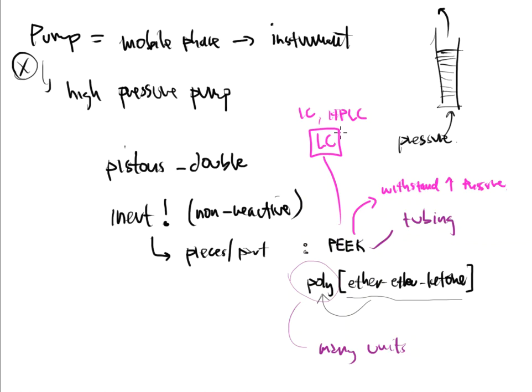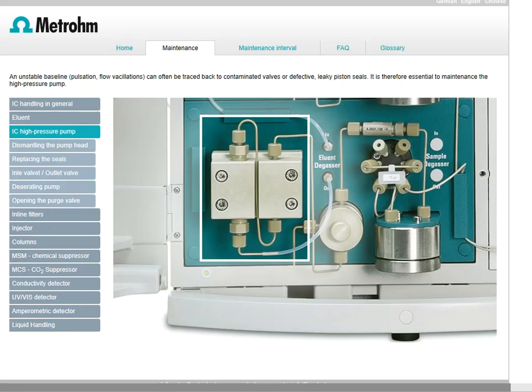All right. So let's take a look at this pump that we are talking about. What does this high-pressure pump look like? Well, hold on. Let me show you a picture. So here's an image of the internal of the IC instrument that you're going to see in our laboratory. So this is really for the Metrohm ion chromatography system. However, most of the ion chromatography systems look very similar to this. And quite actually, any HPLC instrument will also have a very similar look on the inside of it.